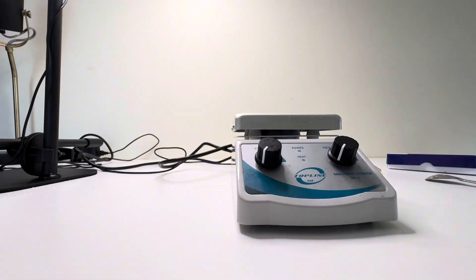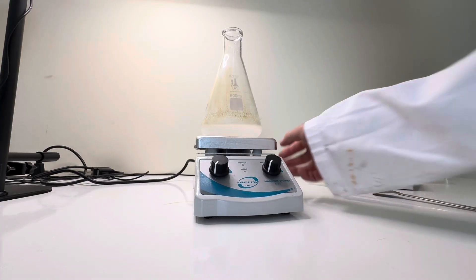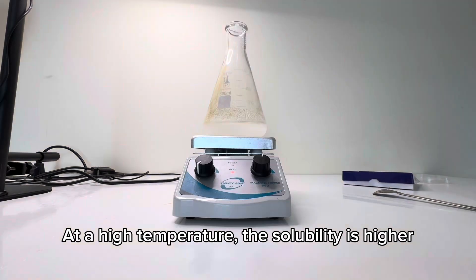Now to dissolve it, we'll use a hot plate. Heating lets us dissolve more than normal. At high temperature, the 100 grams can dissolve in this small volume of water.